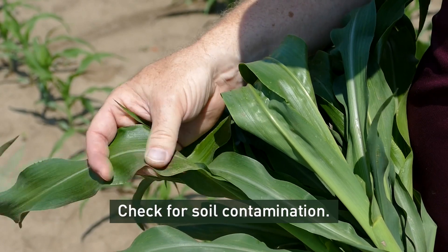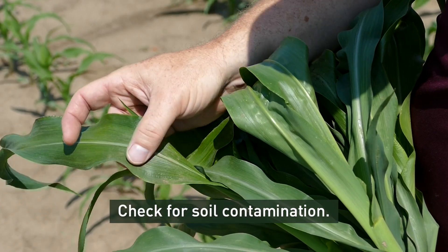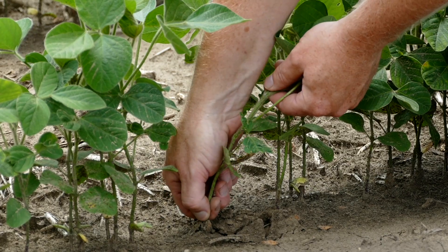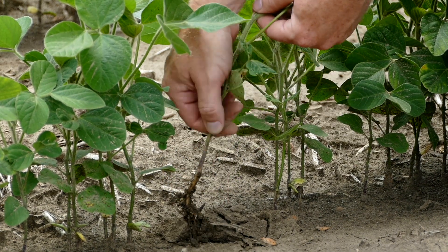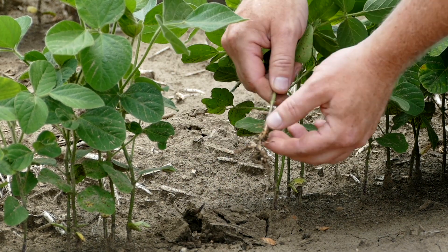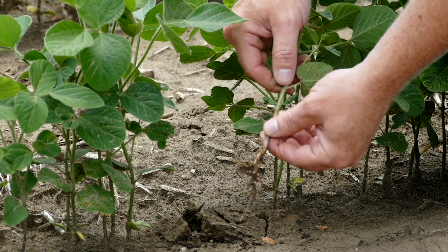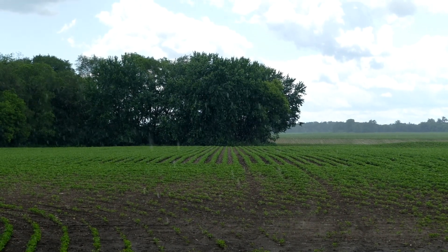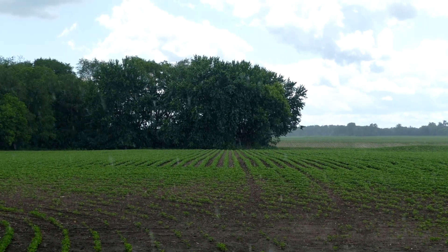It's important to check your samples for soil contamination as you're collecting them. Small plant samples collected from fields that are not fully canopied are especially susceptible, as rain splashing on the soil surface can leave soil particles on the lower parts of the leaves.